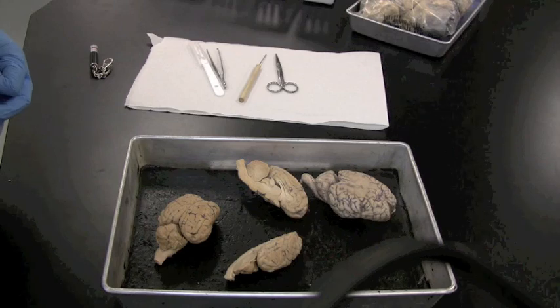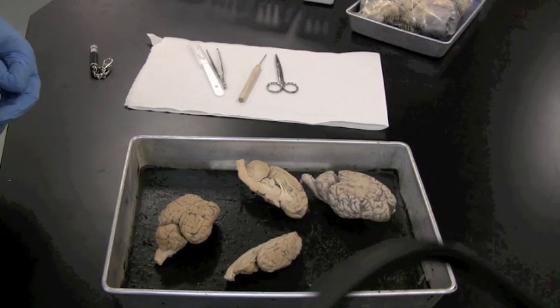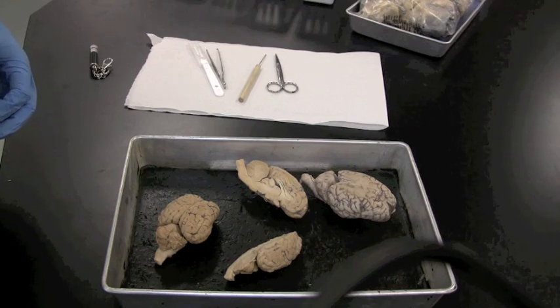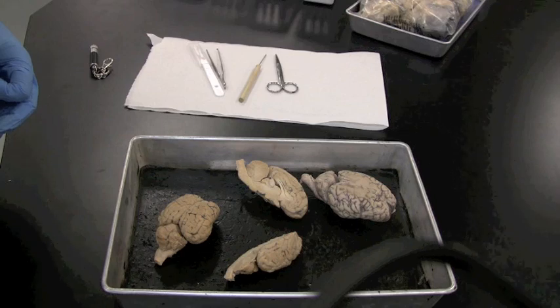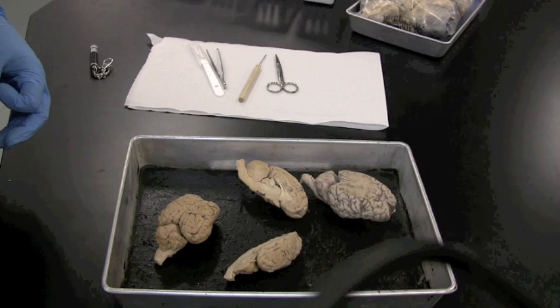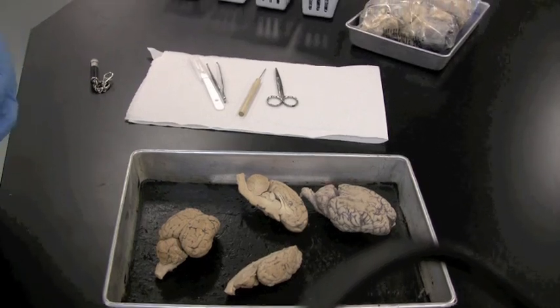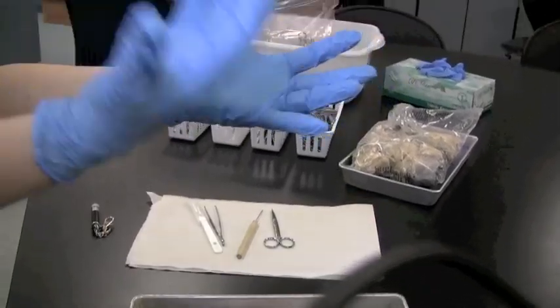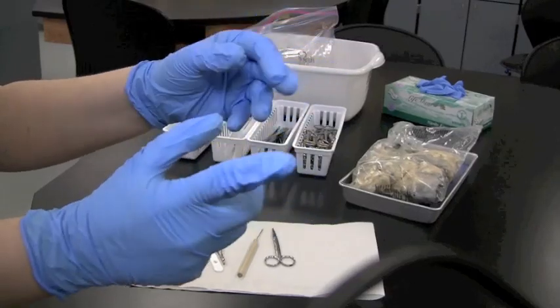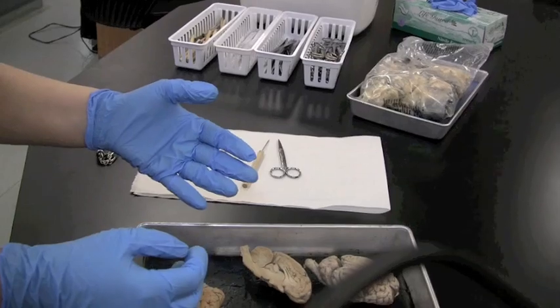Welcome to our Bio 201 brain and eyeball dissection. This is our quick version to remind you of what you've already done in class, or if you've missed class for some reason. It's easier to see sometimes than when you're looking at pictures on the histology slides. These are our players, lefty and righty, taking you through everything you need to know today with our sheep brain and then our cow eyeball.